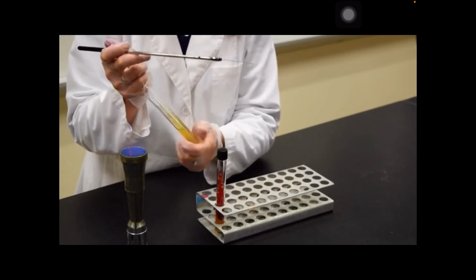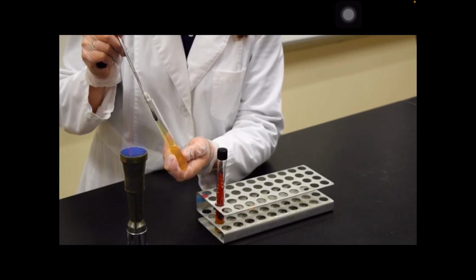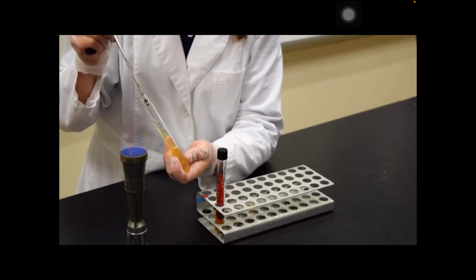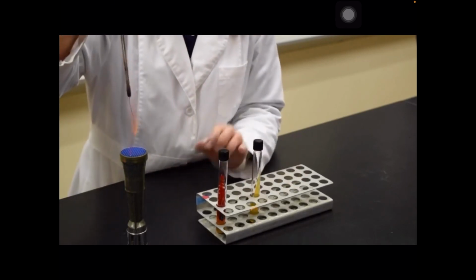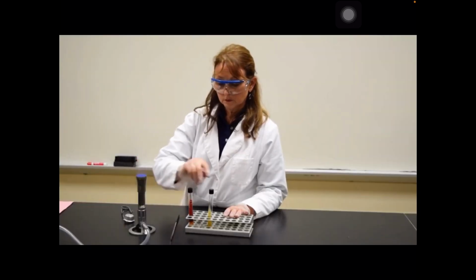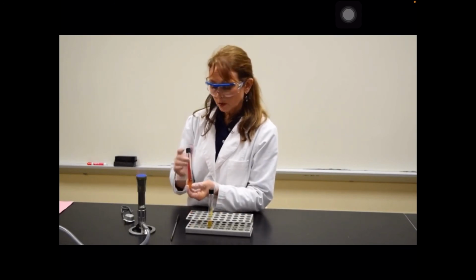Open up the cap of the tube that you'd like to inoculate, take the inoculating loop, put it on the bottom of the slant, on the surface, streak it back and forth as you go up the tube. Replace the cap. Sterilize the loop. Place your tube in the incubator. In the next class period, you should find growth throughout the tube.